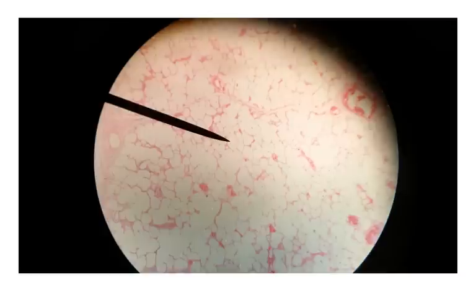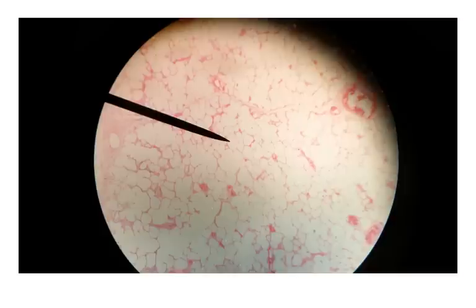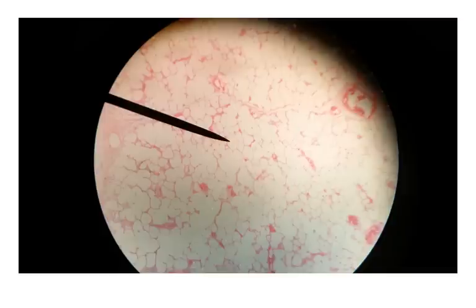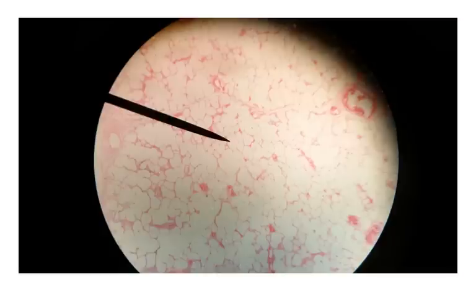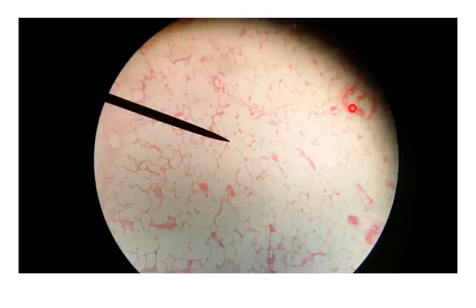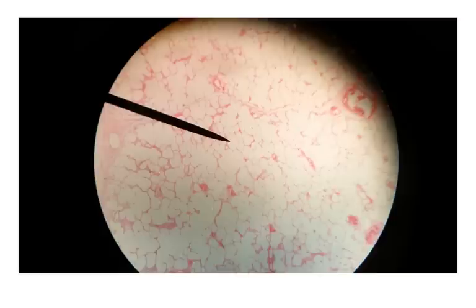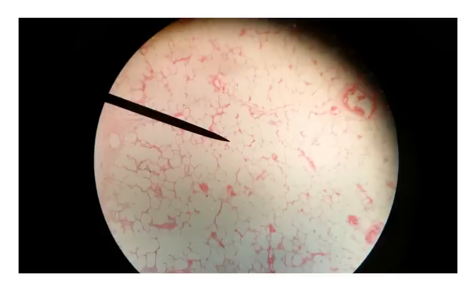Now let's move deeper into the rest of the lungs. Here at low magnification, most of what you see — these open spaces — are alveoli, the air sacs that fill with air when you inhale, constantly expanding and contracting with each breath. Here and there you'll see actual blood vessels; some of these larger ones are arteries and arterioles, and if you look really closely you can see capillaries responsible for CO2 and oxygen exchange.